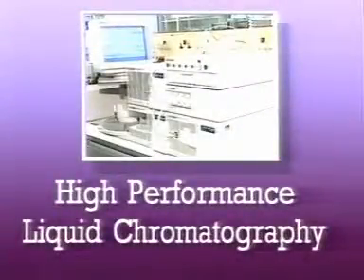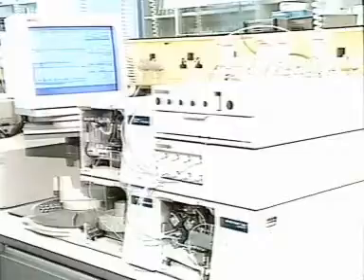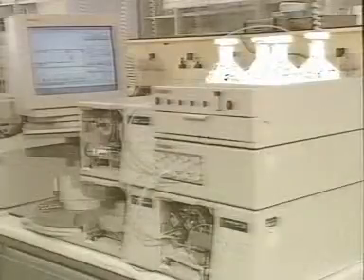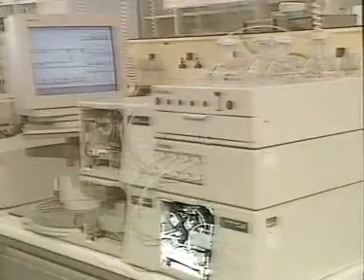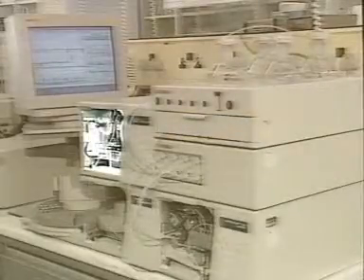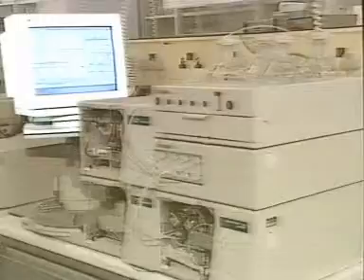High-performance liquid chromatography, usually called HPLC, is a powerful technique capable of separating very similar compounds, even pairs of optical isomers. In this instrument, up to 4 separate solvents can be used for separation. The mixture is pumped under high pressure through the separation column. Absorption of ultraviolet radiation is used to detect the separated compounds at the end of the column. The process and the storage of data are controlled by a computer.